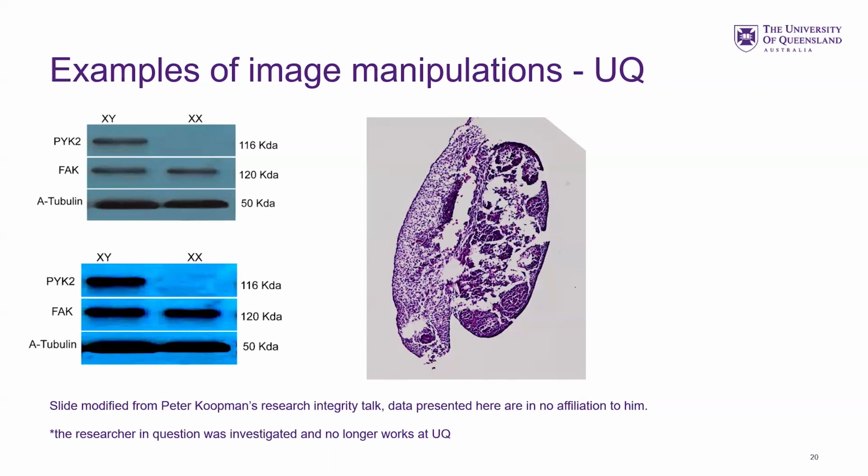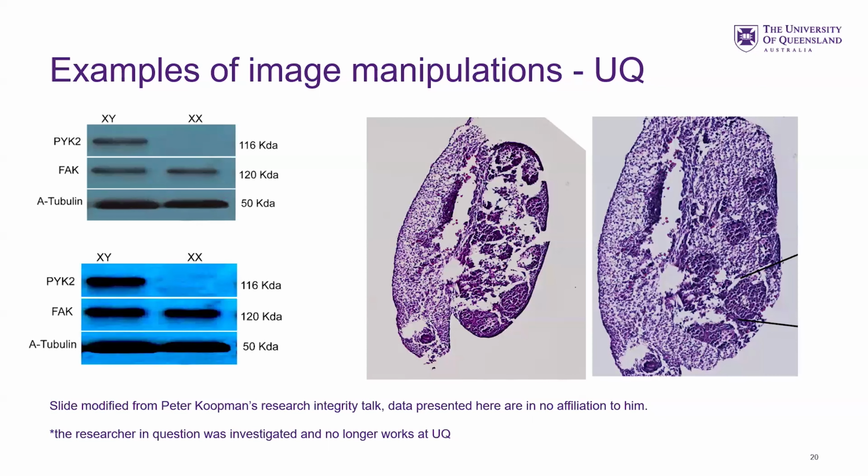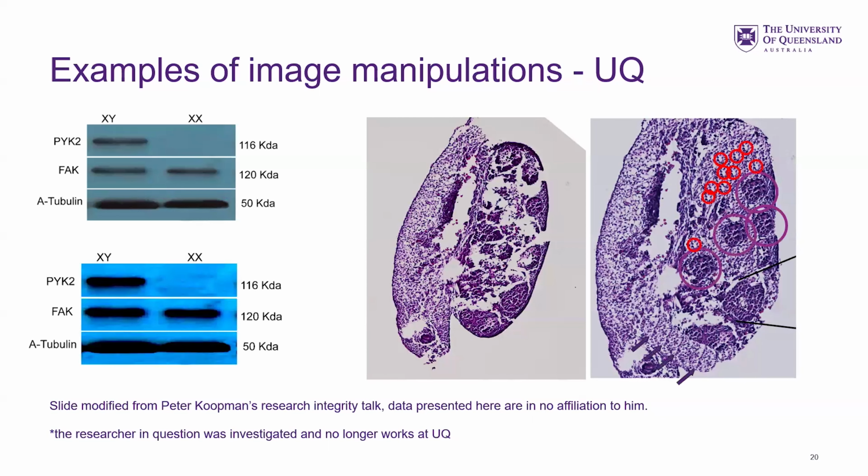This was a histology section, and that's what was presented. They artificially fixed all the horrible tears from the section by reusing stuff. So this stuff does get caught, so you don't want to risk your hard-earned PhD and honours projects by doing image manipulation.